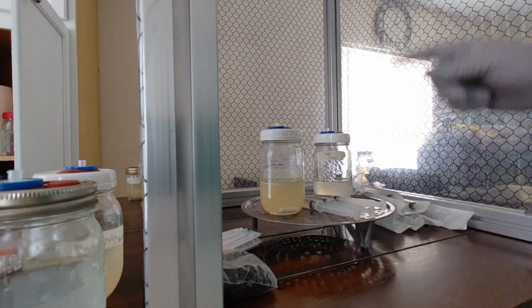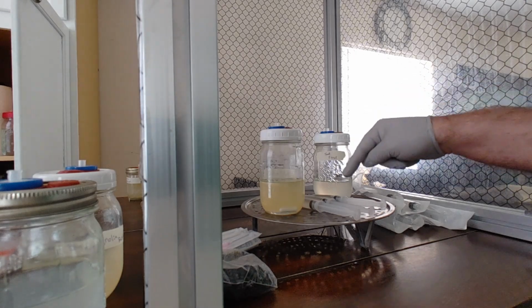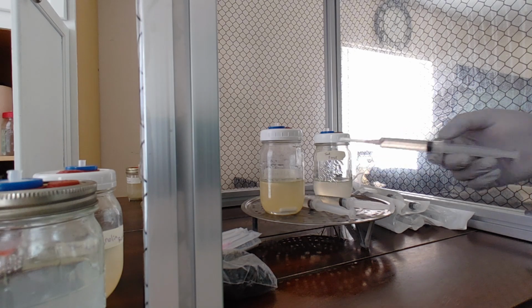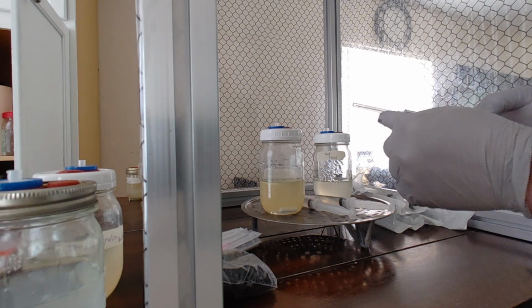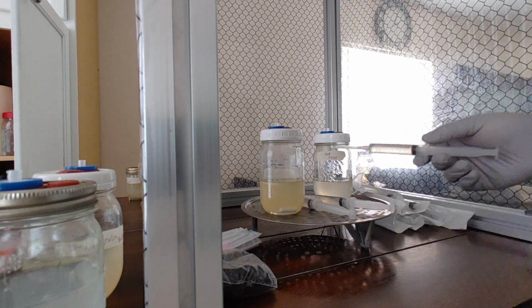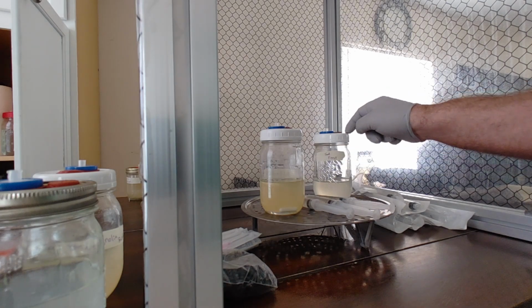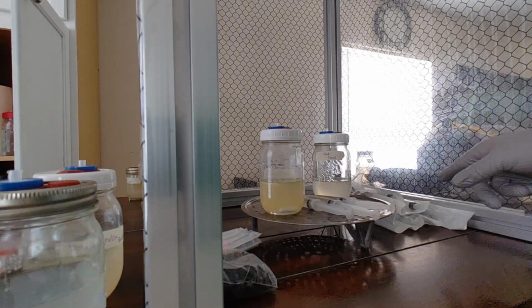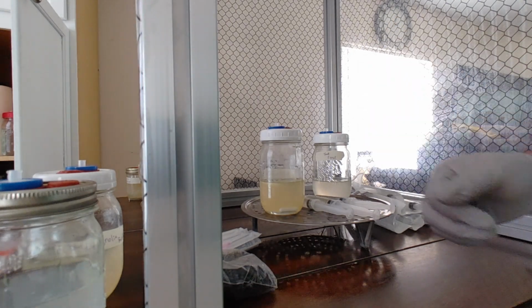You're good to go. Now, if you're reusing these, you definitely want to burn the tip first. You torch it till this needle turns red hot before it goes into the LC. But because they're gamma radiated from the factory, the first time you use them, they're good to go.